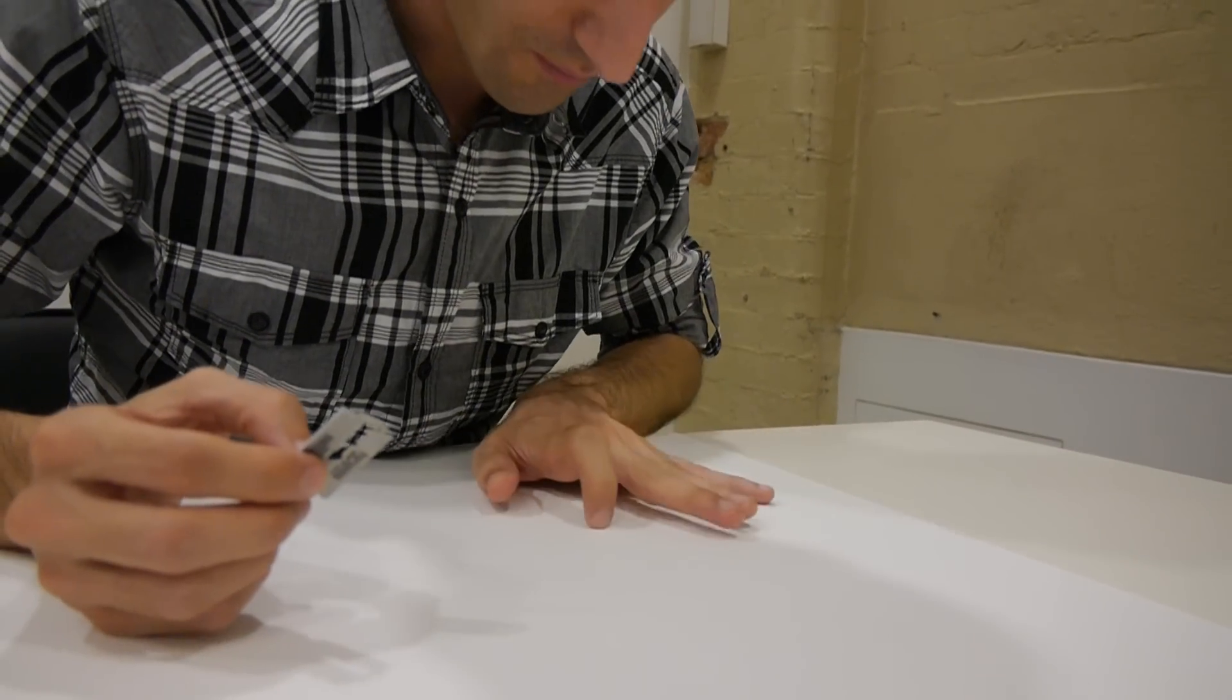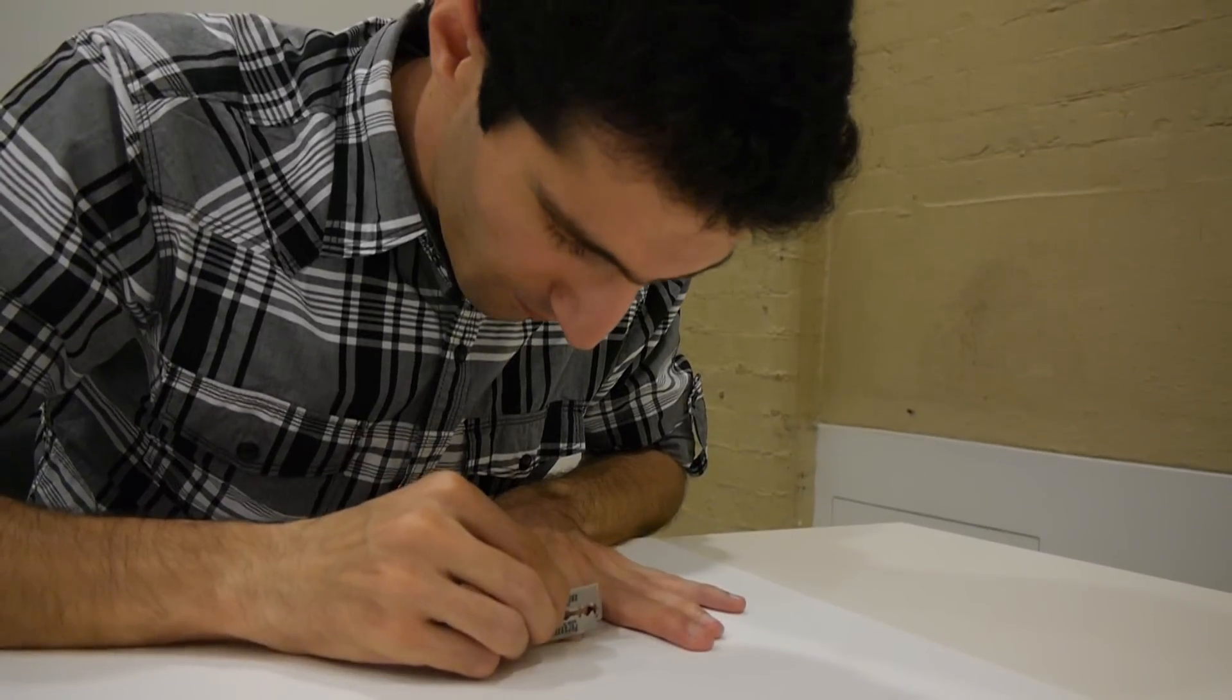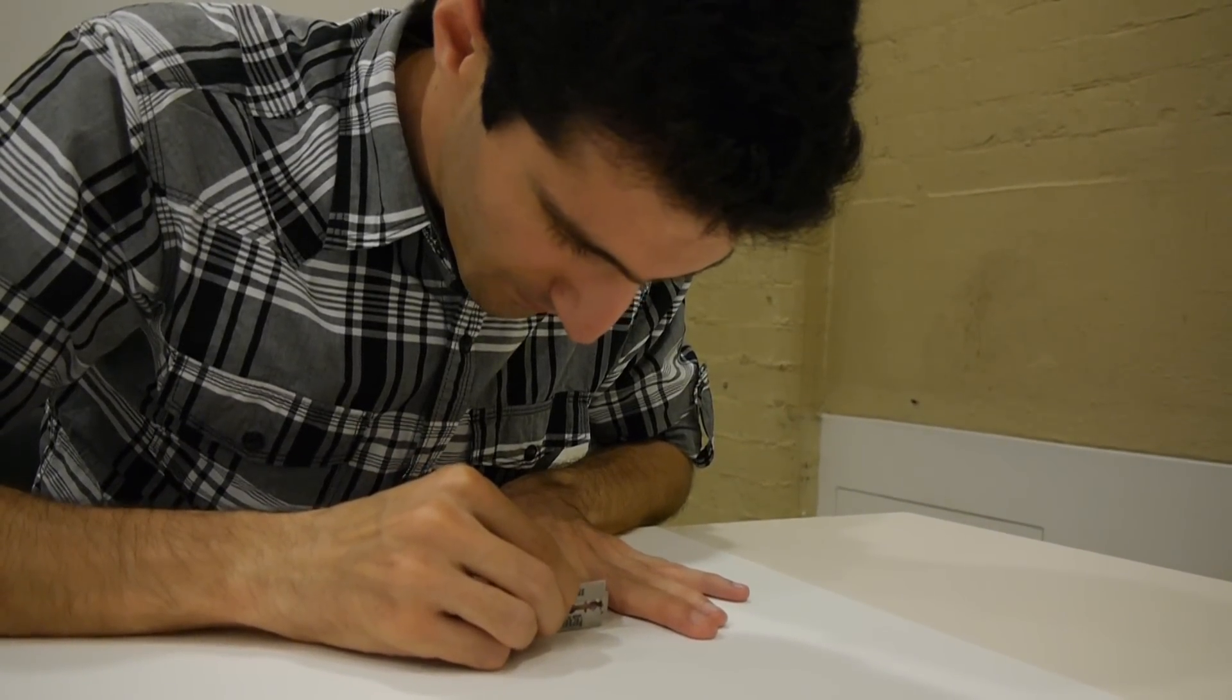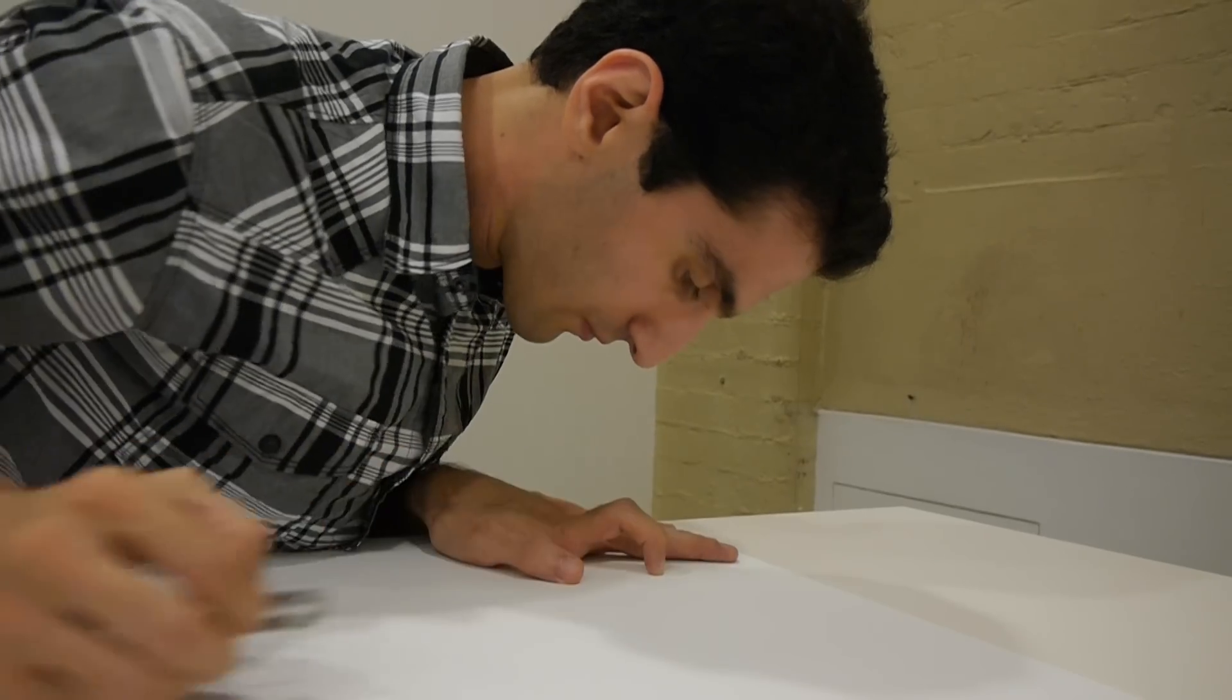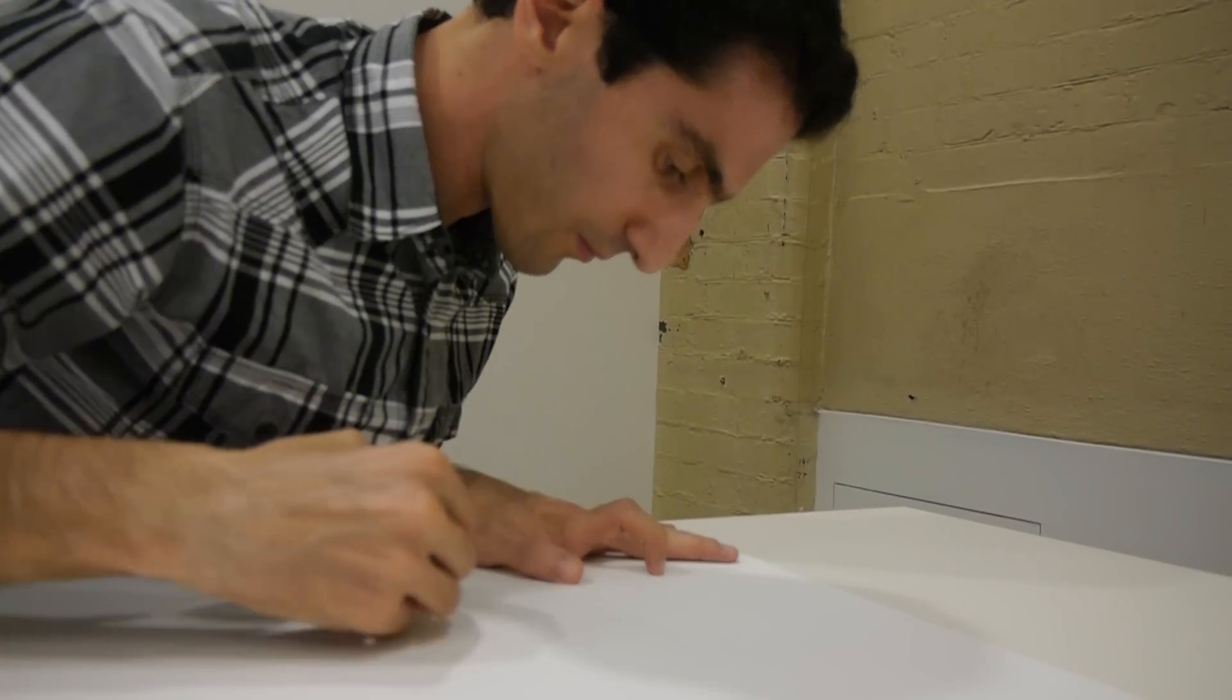It is important to remember that when using either technique, it is extremely important to view the sample directly above. This will help ensure that the razor blade slices vertically through the sample as well as in the desired spot every time.